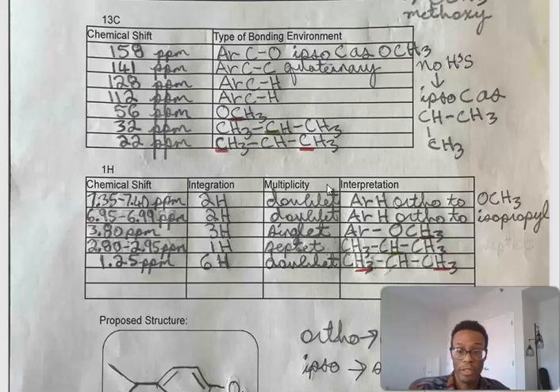We have 7 carbons in total, but 10 in the formula. That symmetry suggests a para-disubstituted benzene ring.